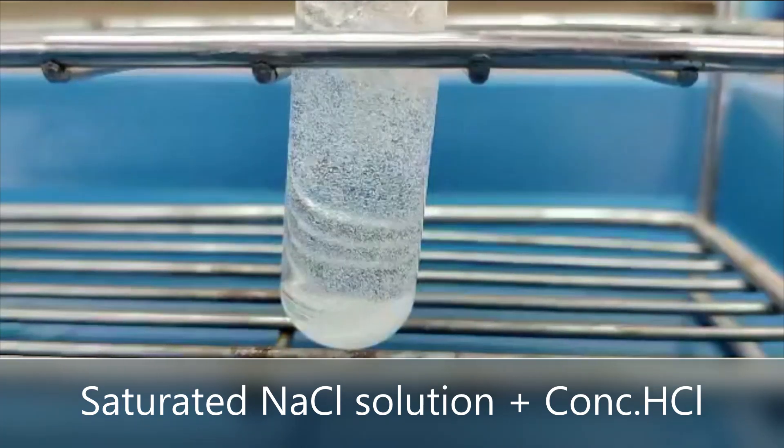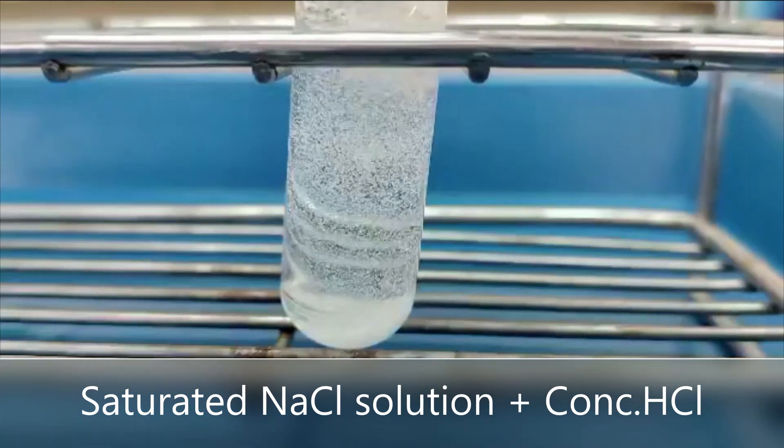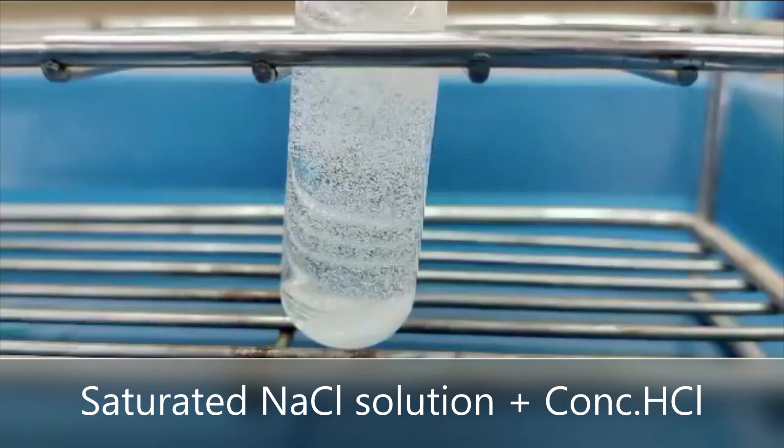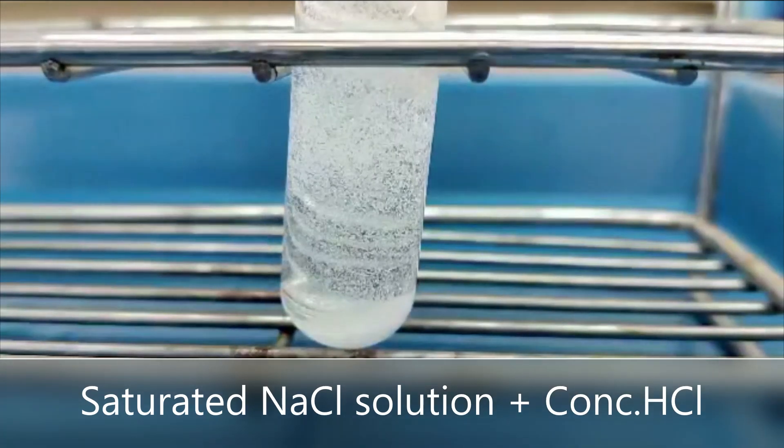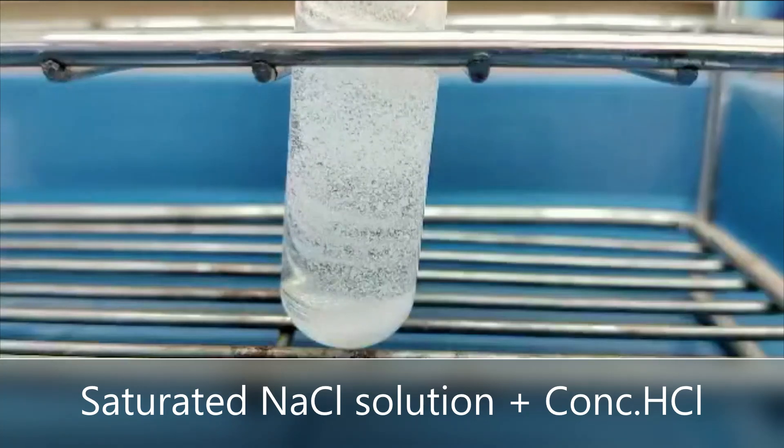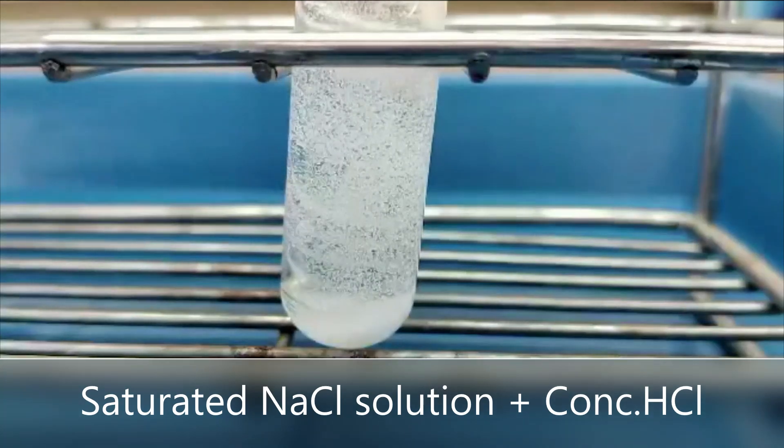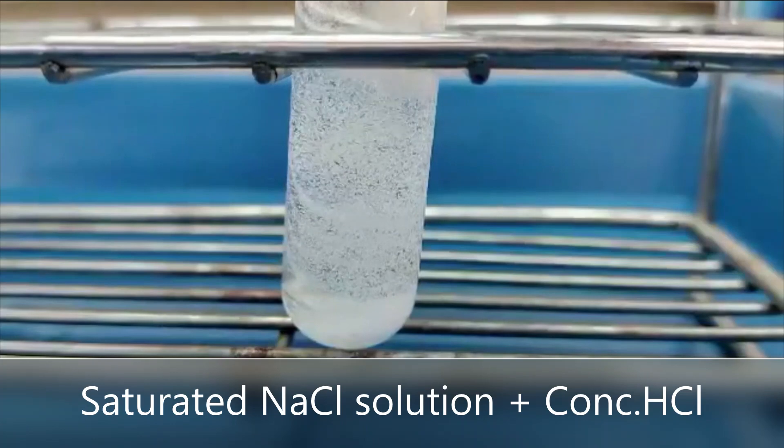From observing the experimental results, we found that when concentrated hydrochloric acid was dropped, white sodium chloride salt crystals began to precipitate out like snowflakes, very beautiful. So why are the results like this?